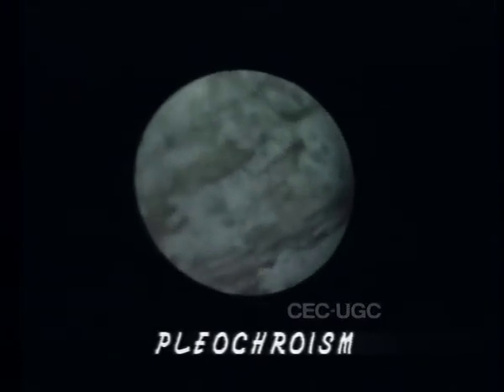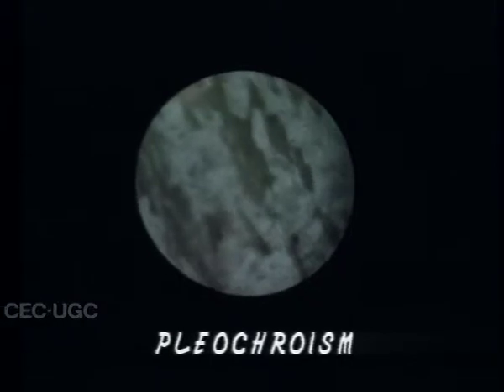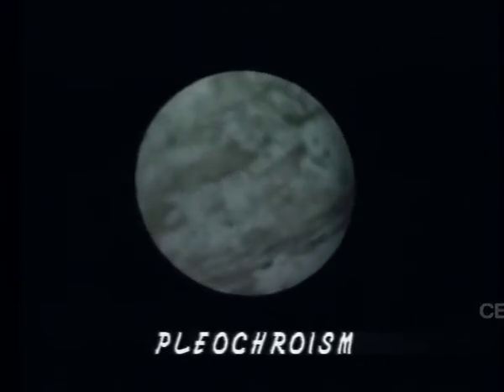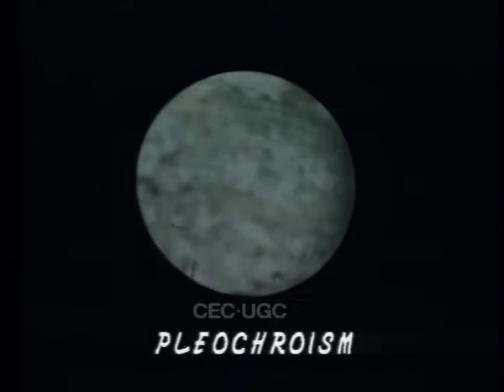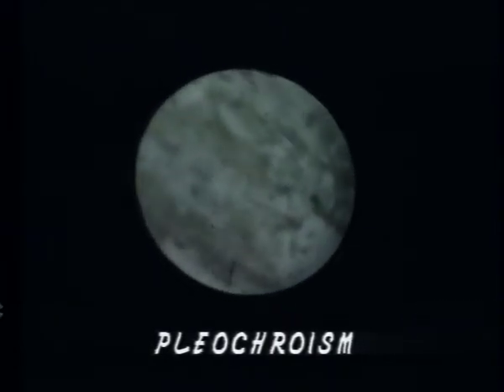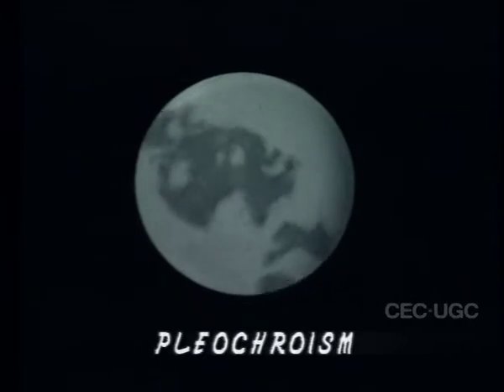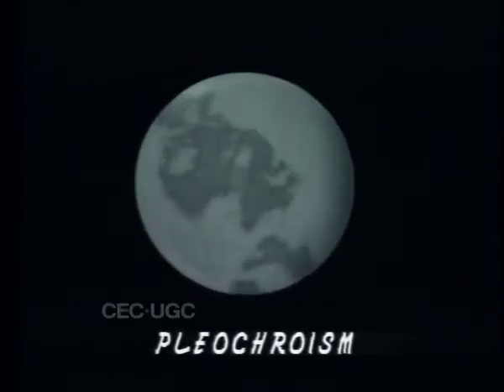Pleochroism is the result of changing the orientation of mineral with reference to polarizer vibration direction, because of which refractive index and absorption characteristics of the mineral change. Pleochroism is distinctly observed in minerals like biotite, tourmaline, etc. Pleochroic colors are characteristic features of these minerals.